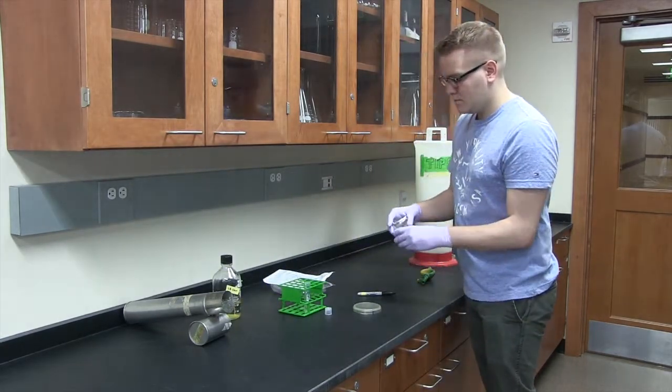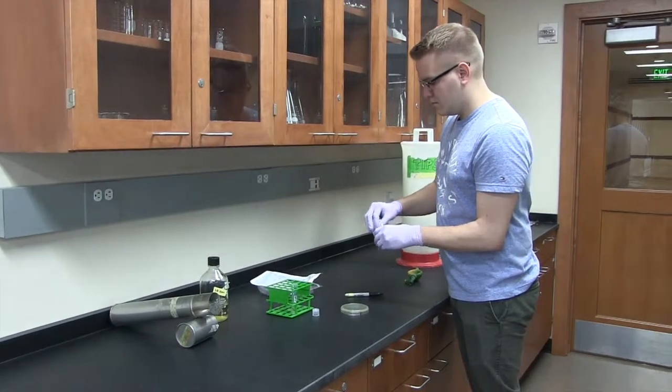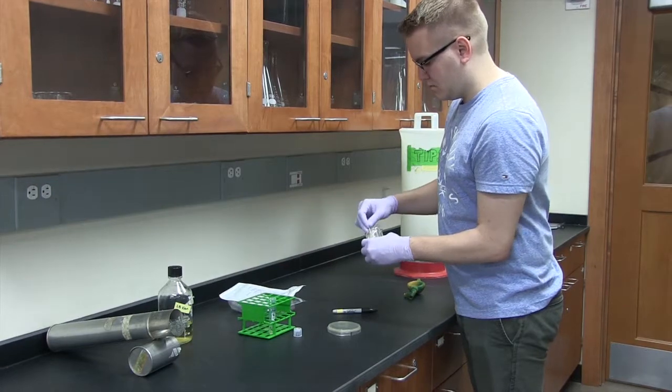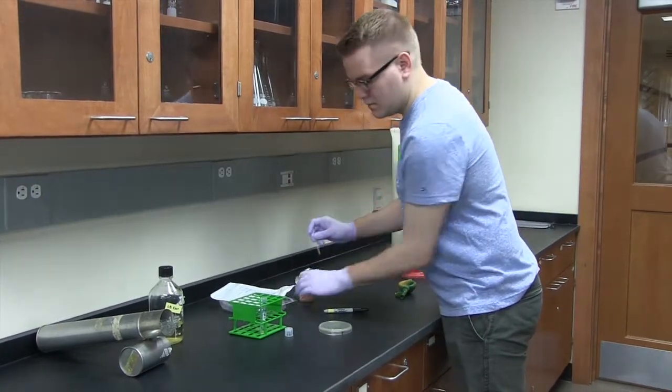All right, now he's going to take this plate that has colonies on it, and use sterile toothpicks to pick colonies.